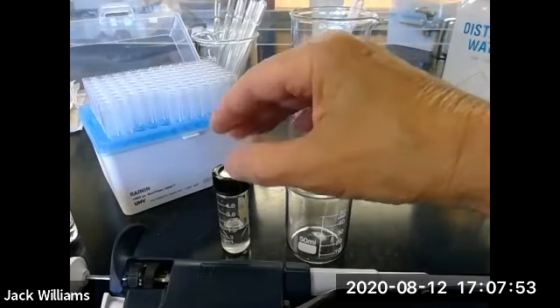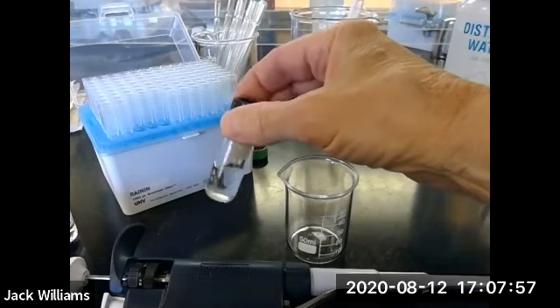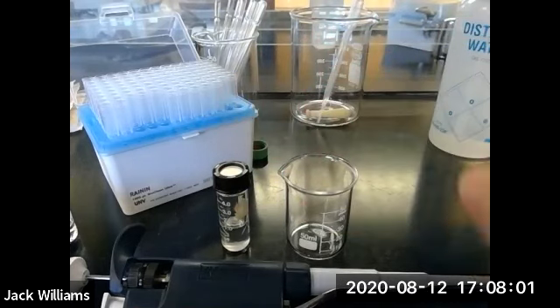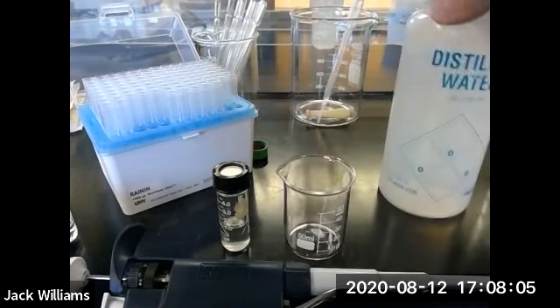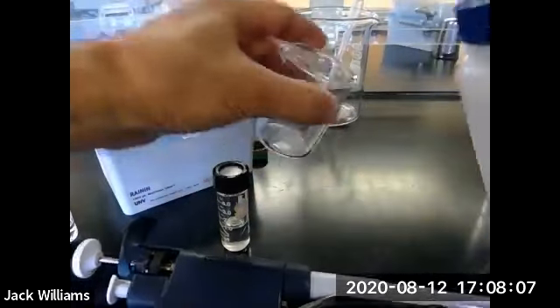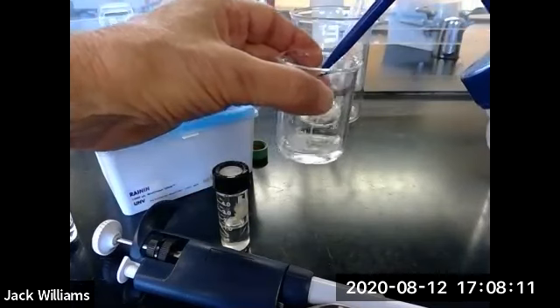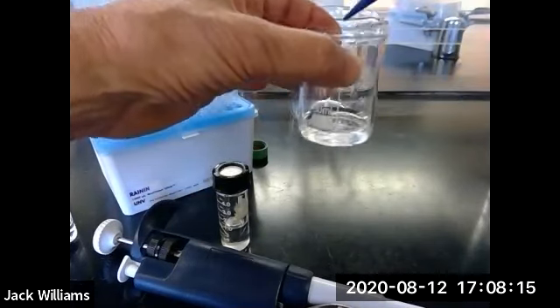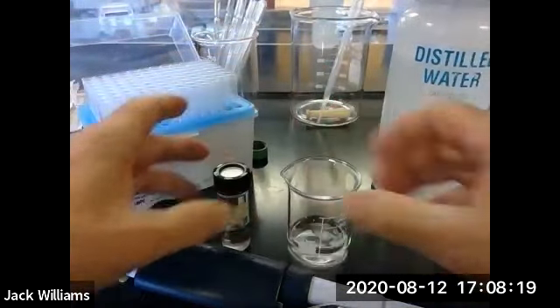Okay, we're back. The benzoic acid has completely dissolved in the methylene dichloride, and now we're going to add 600 microliters of water. Now you've got a little 50 ml beaker. You can take your water bottle and simply add water. You're only going to have to use 600 microliters, so you don't have to add much, but I would give you a decent volume so you can get that pipette tip below the surface.